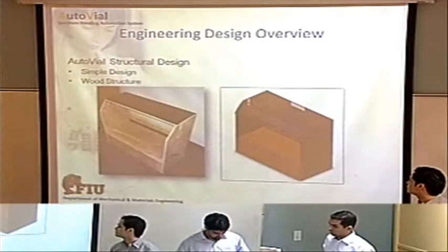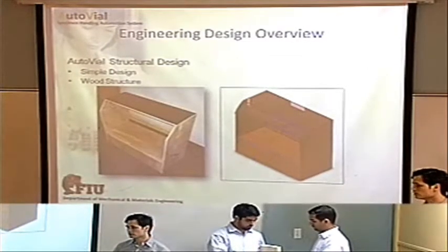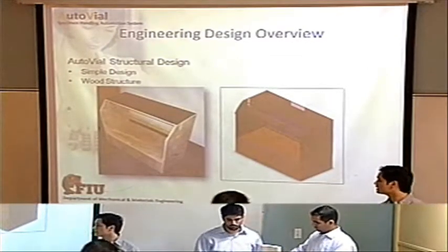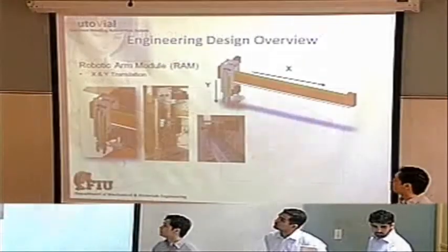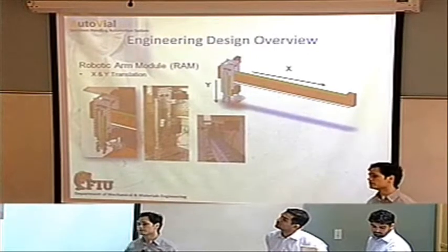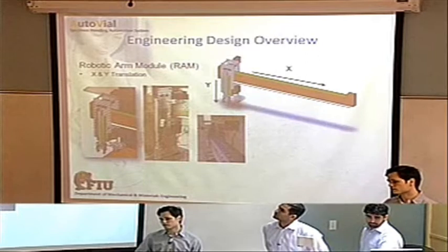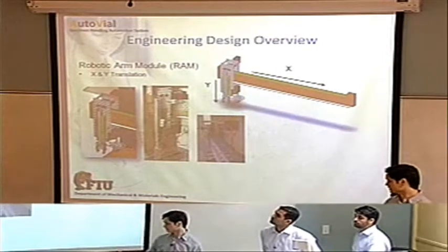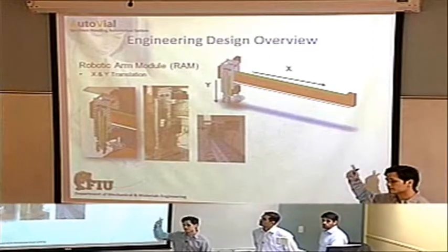One of the best features of the AutoVial system is its flexibility when it comes to size and design. We utilized that feature and made a simple wood design. The robotic arm module, or the RAM, will provide the X and Y movement for the task that is needed. It does this using a rack and pinion system in both directions.